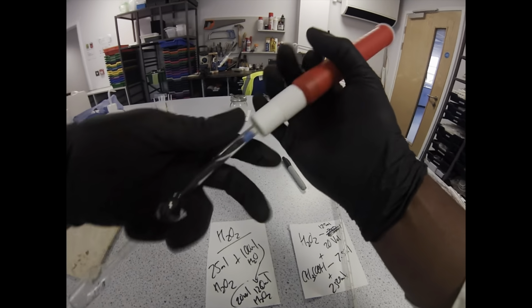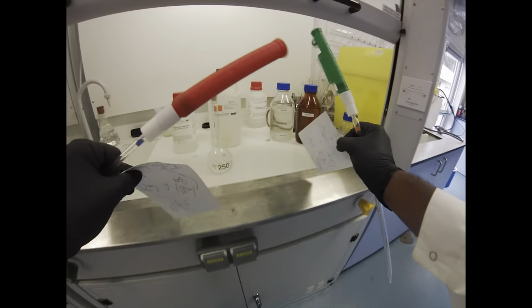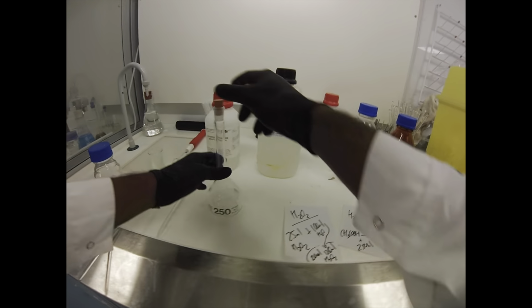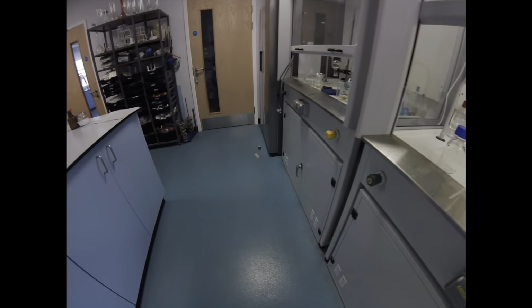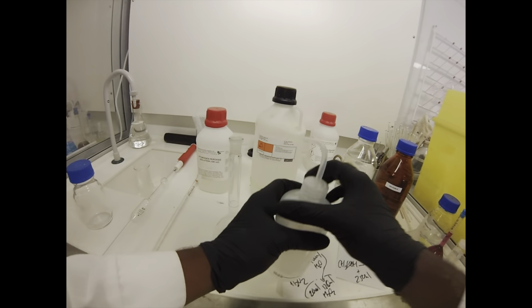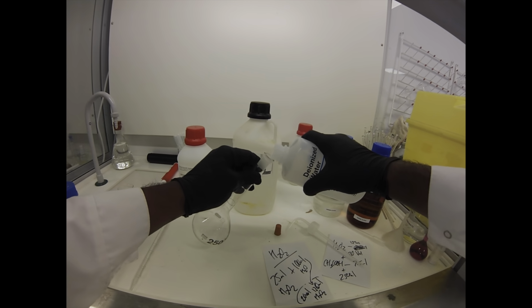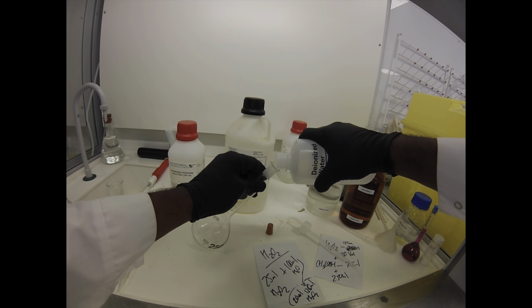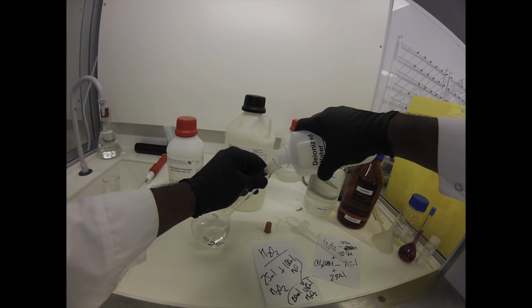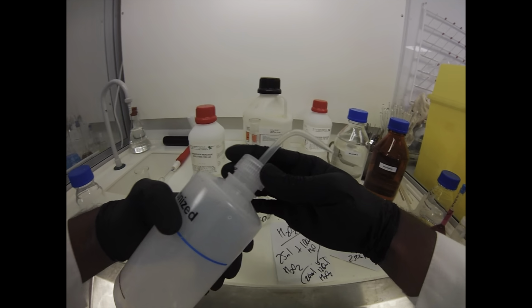I'll pop these fillers onto these pipettes and we'll take it over to the fume hood and we'll just dispense everything in the fume hood. I'm going to make it up in this clear 250 ml volumetric, and then I'm going to dispense it into a brown glass container. You want amber glass to be able to stop the hydrogen peroxide from decomposing as quickly. Acid to water, never water to acid. I'm not sure if it's the same for peroxide, but we'll add 1/2 to 2/3 of the final volume of the water into this volumetric anyway, and then we'll start dispensing our liquids into it.